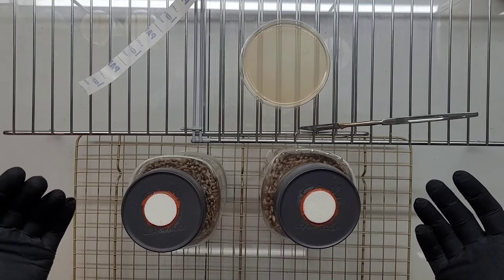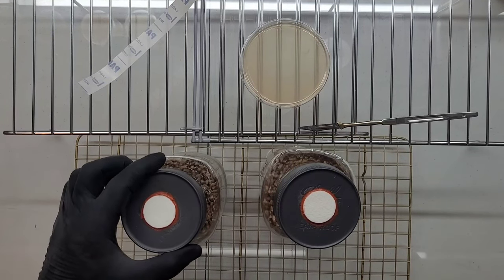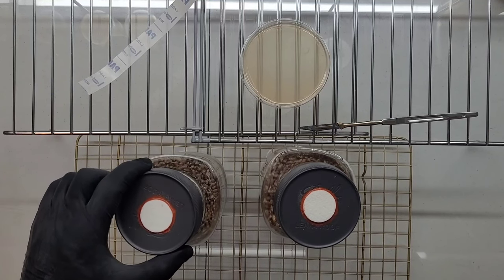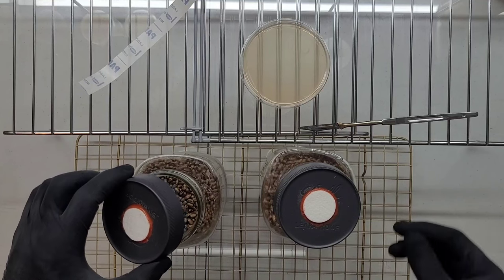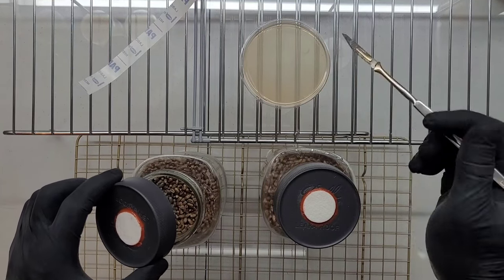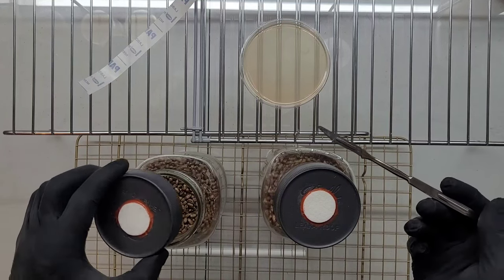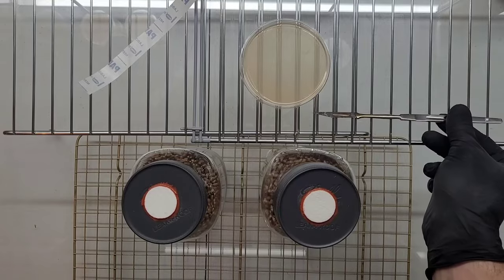Now this is basically how you run your still air box. The same applies to liquids if you're inoculating a liquid culture. The same applies with a loose lid. Open up your jar by clamshelling. Take your proven clean culture, inoculate, close, and allow to colonize at room temperature. And that's essentially it.